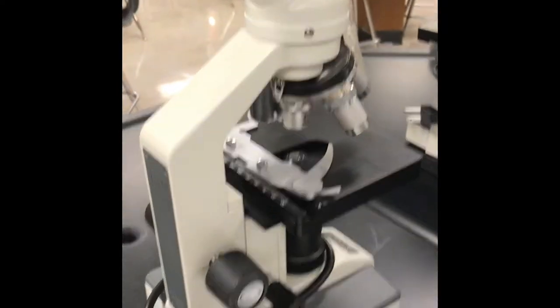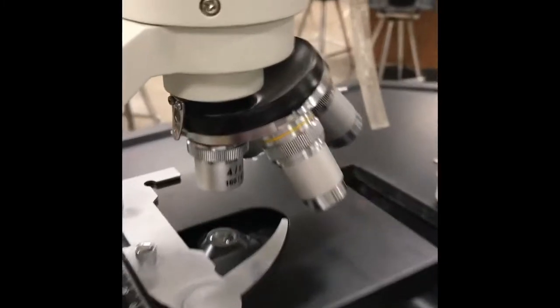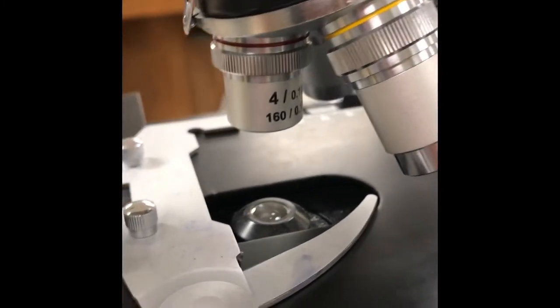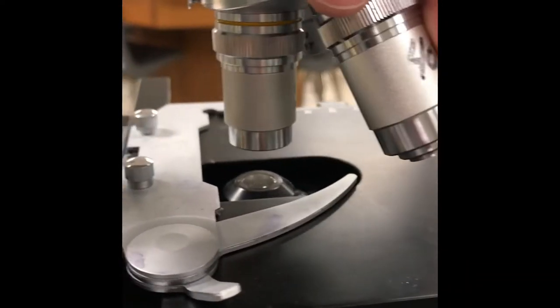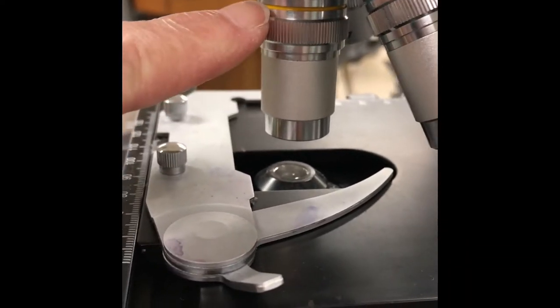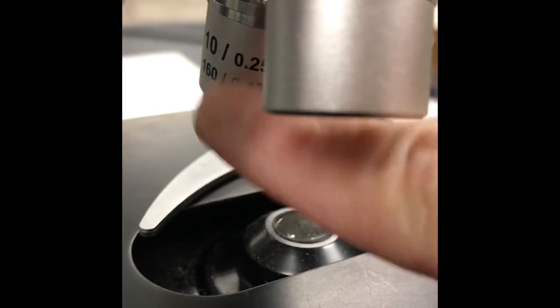We do have our fancy microscope. You can see right there. We're going to be using, I don't use the super low power, but this is a 4. We don't use that one in AP. We start off with the yellow banded objective right here. And the power is on this side. That's a 10. You can see it through there. That's the yellow one where my finger is right there. That's a 10X.